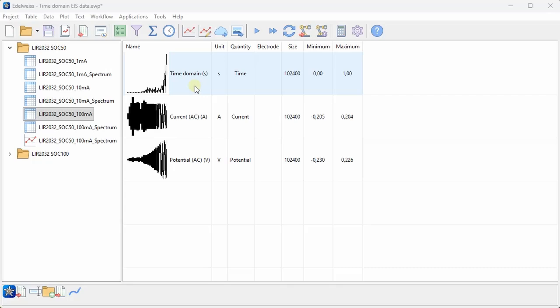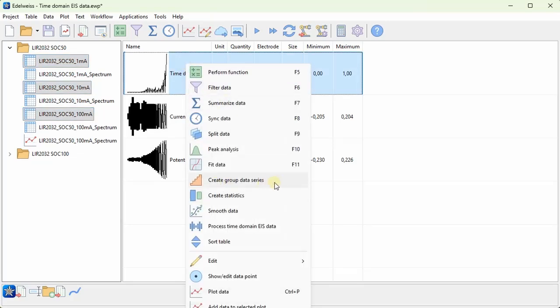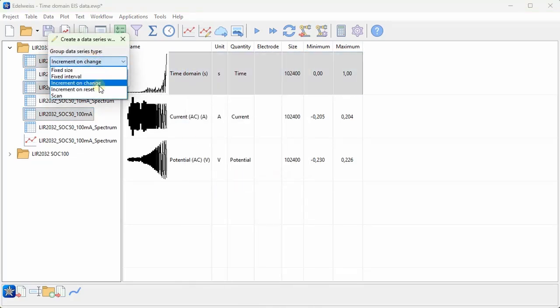And to show this data properly, it might be useful to have some information about how to group this data into each separate frequency. So to do that, I'm going to also select my other two tables containing the time domain data, and then right click on the time domain and choose create group data series and increment on reset, since the time resets every time we have a new frequency. And if this is unfamiliar to you, you can see more in the tutorial video about creating group data series.